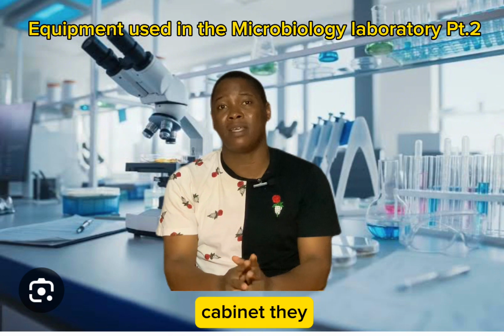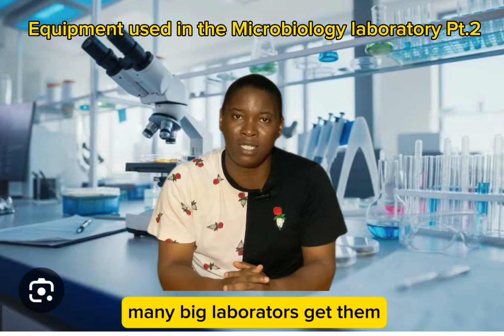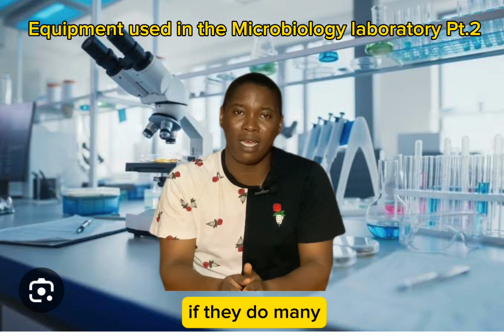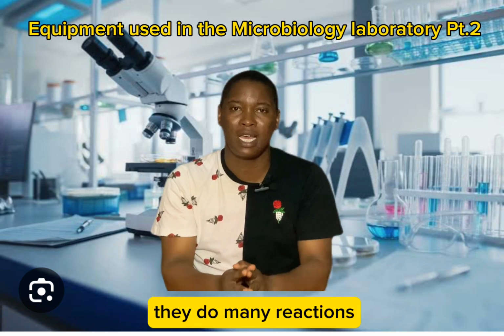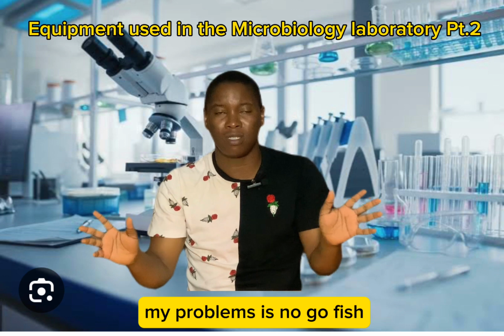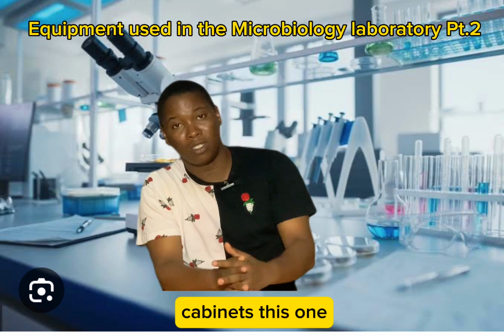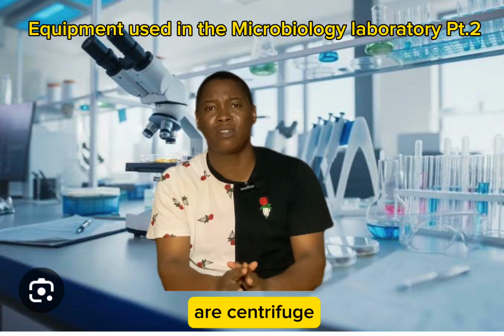So this biosafety cabinet dey very important. Many big laboratories get them, and na controlled environment where we fit dey do many experiments, dey do many reactions, and everything go dey controlled. Microorganisms no go fit see their way into this biosafety cabinet. This one dey important.